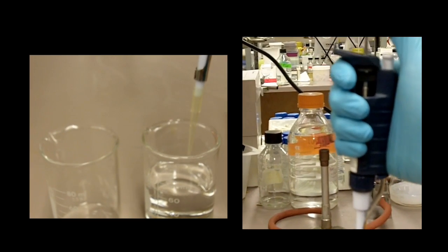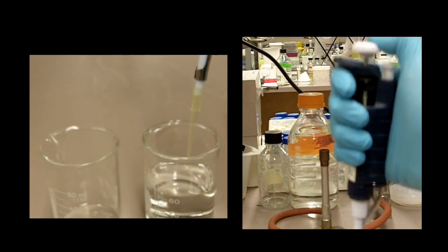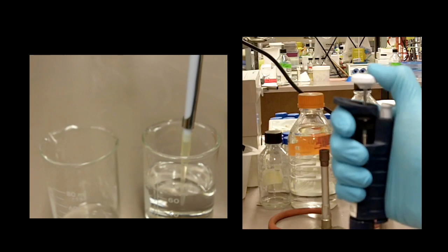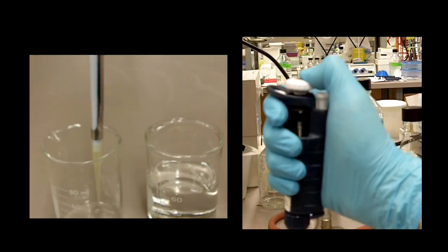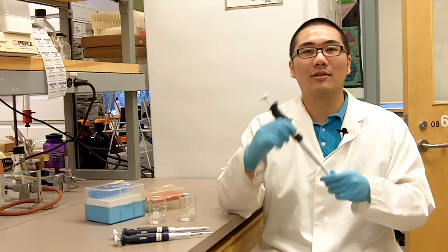Let's do it again. You go to the first stop, insert the tip, withdraw the solution, and then you go to the second stop to expel everything. So this is how you use a pipette.